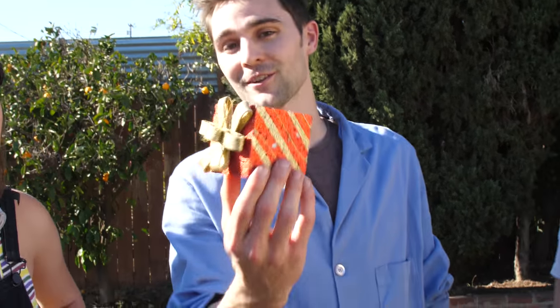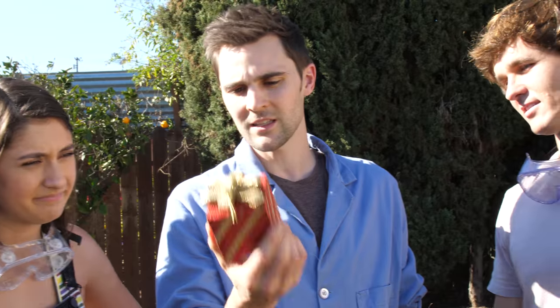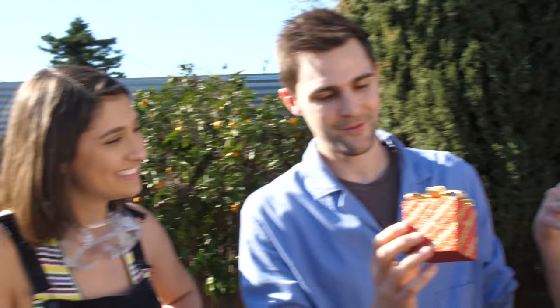Speaking of happier things — Christmas! We have this little thing here as our warm-up melt. What do you guys think this is? Styrofoam? I think that's what it is — I'm not 100% sure, but I think it's really thinly sliced styrofoam. We're going to go ahead and mix them in the piranha solution and throw this in there to see what happens. Predictions? It's going to melt. I think for some reason the bow is going to be okay — I don't know why I think that.